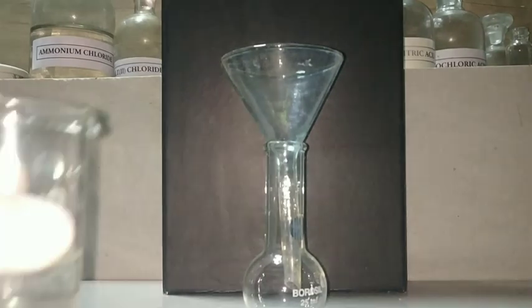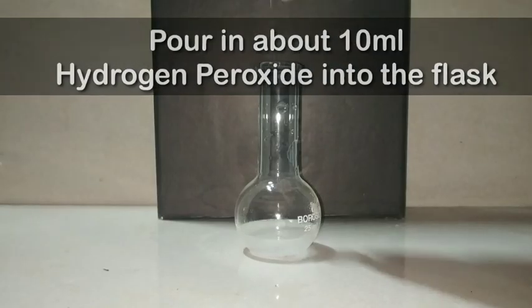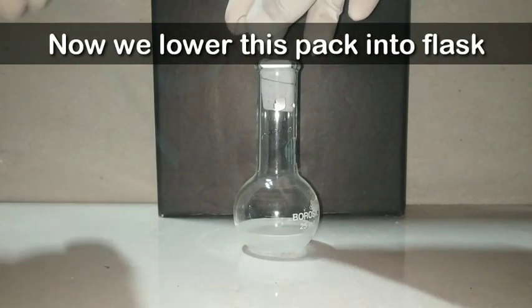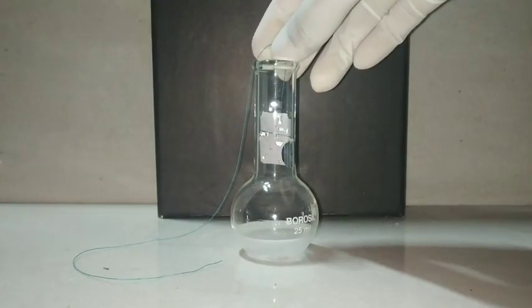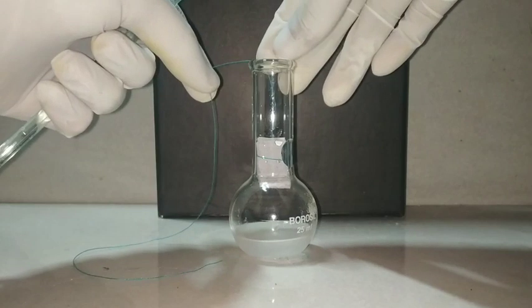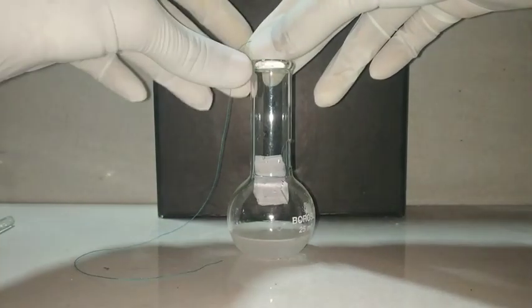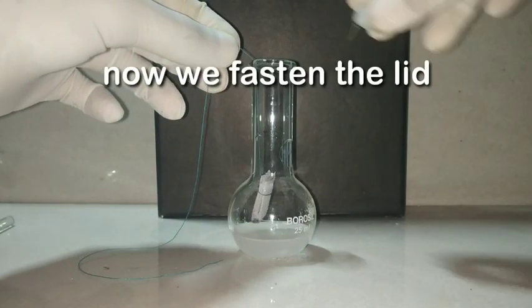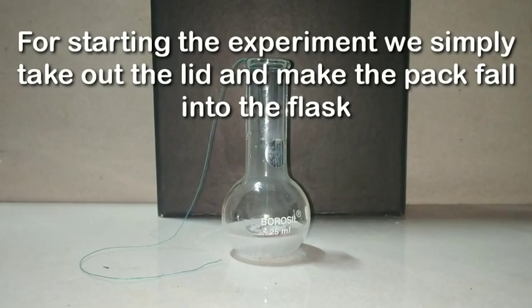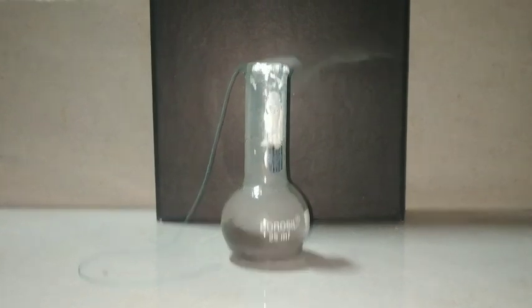This is the container in which we will be doing our experiment. We pour about 10 ml of hydrogen peroxide — the more the concentration, the better the reaction. Now we will place the filter paper pack into the flask. After keeping it just above the flask, fasten the lid. On taking off the lid, the pack falls into the hydrogen peroxide and the manganese dioxide starts to react with the hydrogen peroxide.